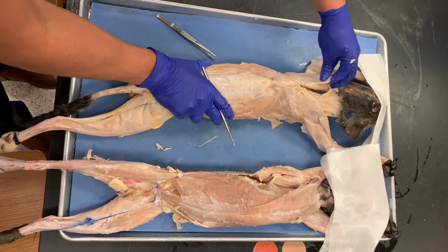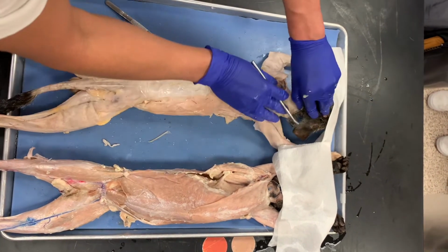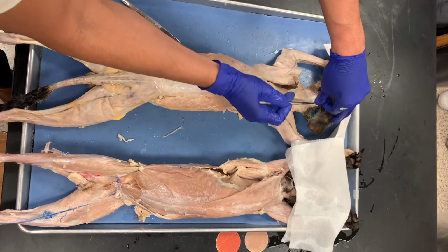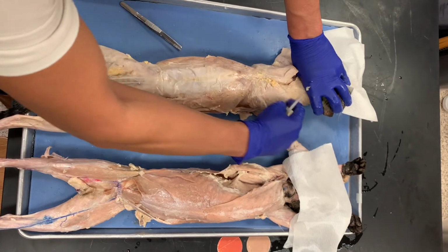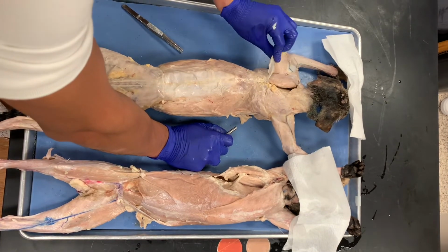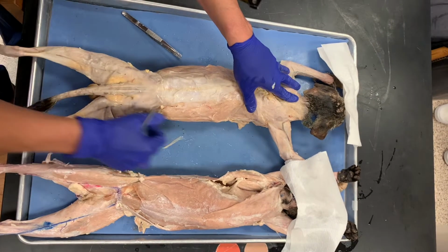And then I have this guy here. This is on the back side, and so the trapezius. The trapezius muscle attaches here on the external occipital protuberance, which is up here at the top, and then it goes all the way down this way and this way to attach to the clavicle and also the scapula. So the upper trapezius would be here. It's just cut at this part, but yeah, backside of that.